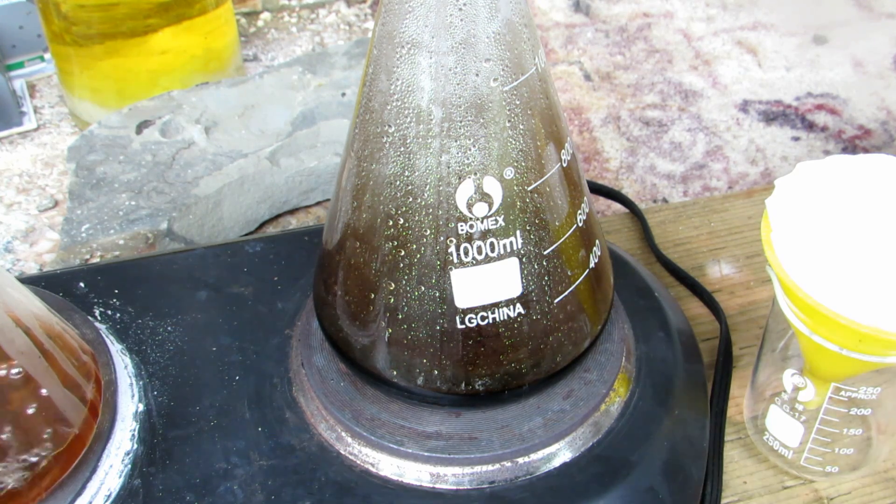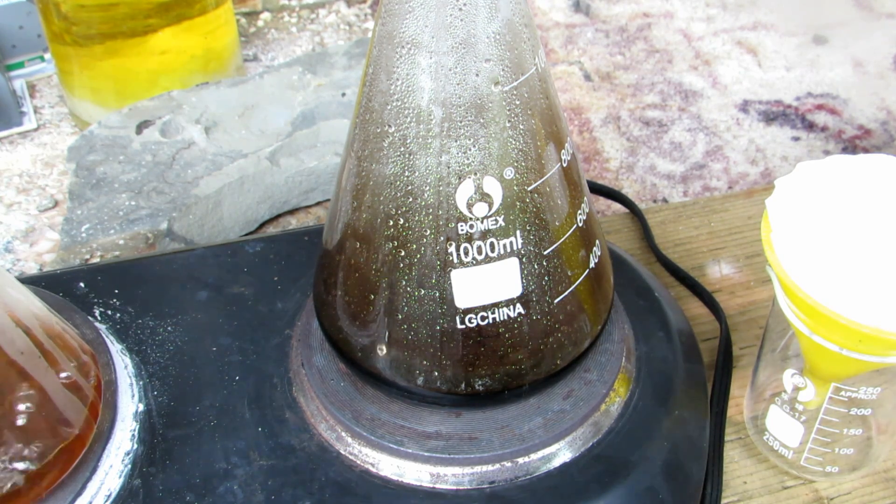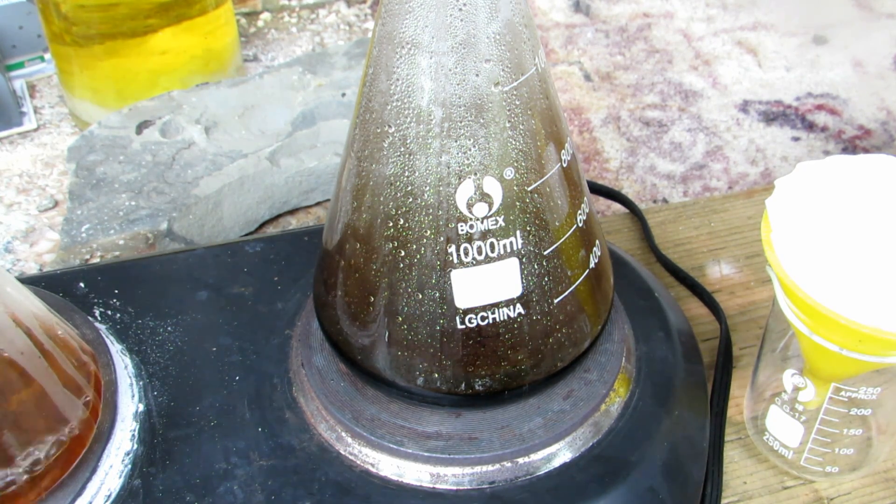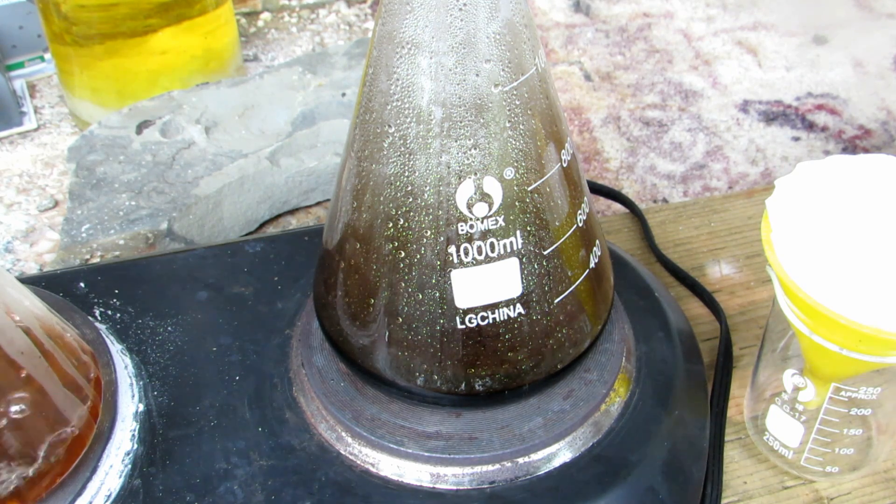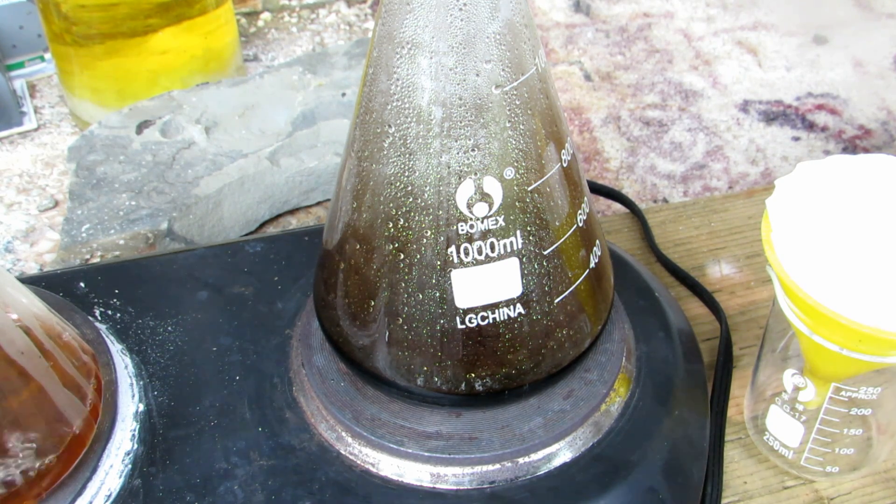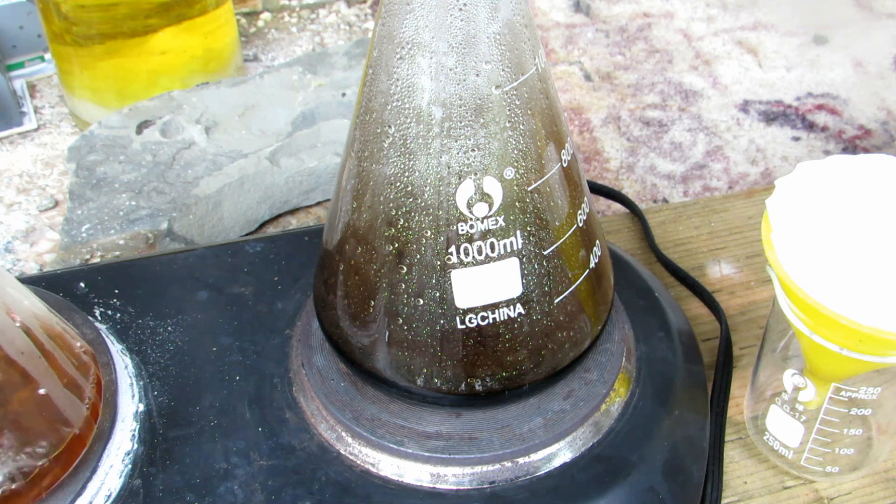I was curious to see if it would work with water. I personally make ethanol myself and then distill it to 95% purity, but it can be difficult to obtain for some people.